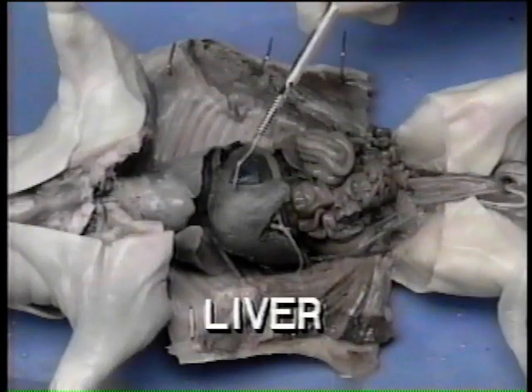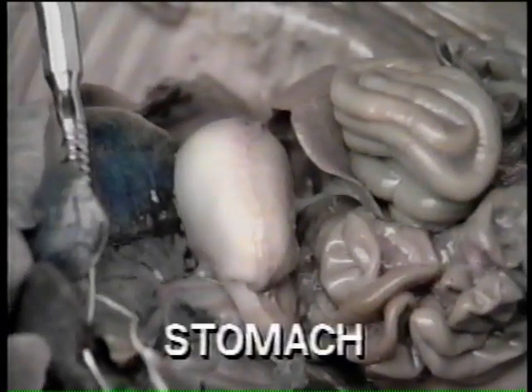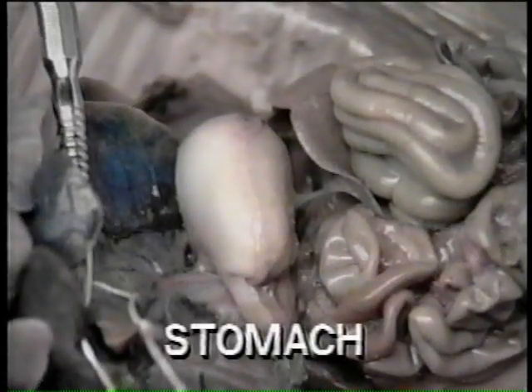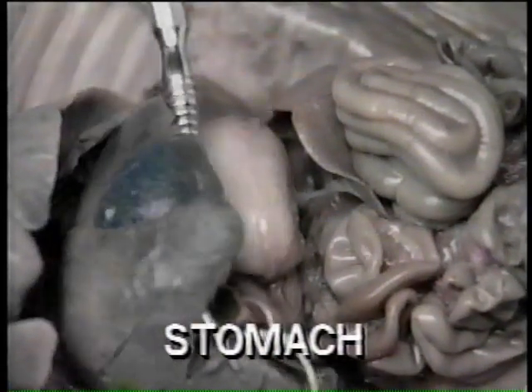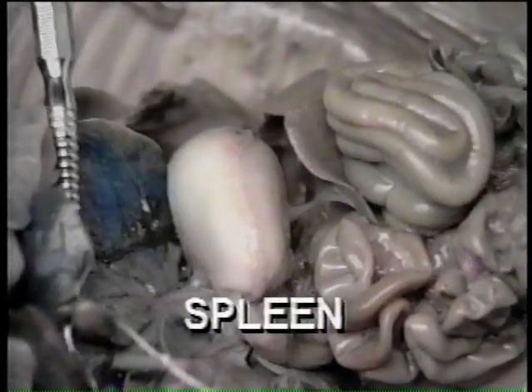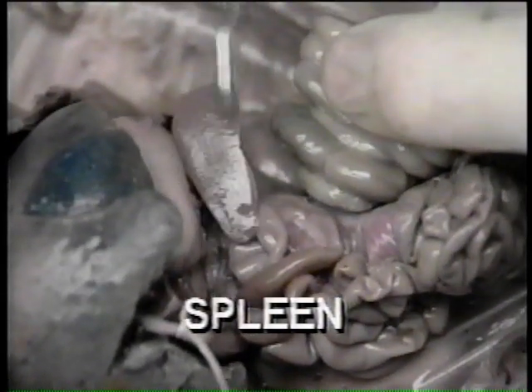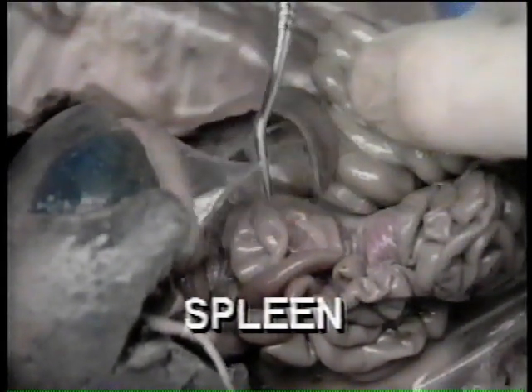Now observe the heart and lungs. The liver is a large lobed structure lying just below the diaphragm. The stomach is a large sac located in the left side of the abdominal cavity and is almost completely covered by the liver. The spleen is the elongated organ attached by the greater omentum to the bottom of the stomach.